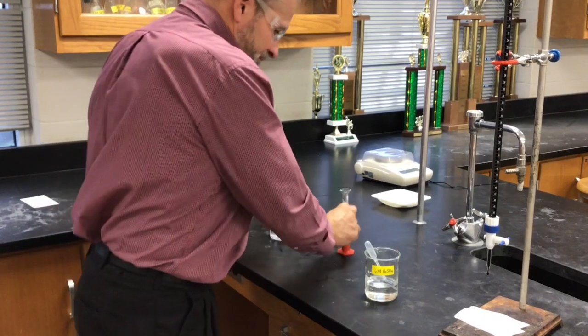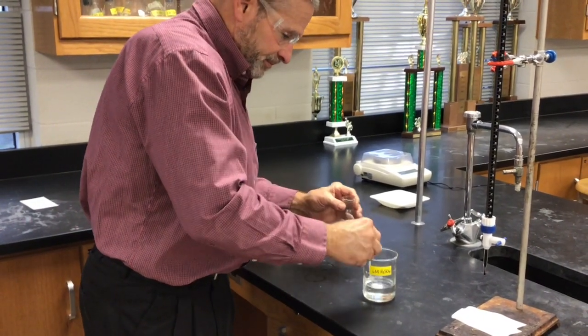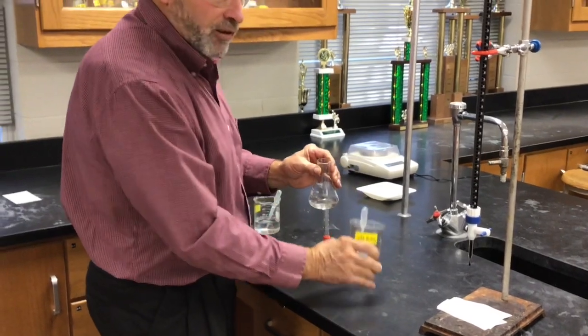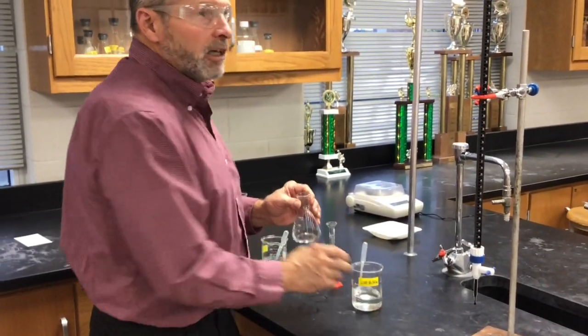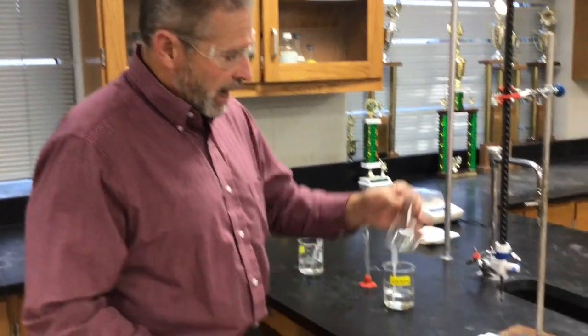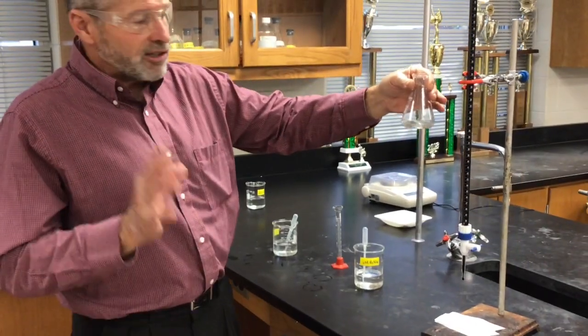Yeah, if some of it had splashed out of the graduated cylinder, that would have been a problem, but it didn't. And I don't have to measure the exact amount of sulfuric acid. We were just trying to make sure we have a big excess of hydrogen ions. And the sulfate ion from the sulfuric acid is just a spectator. It's not going to show up in your net ionic equation. Okay, so my peroxide solution's acidified.